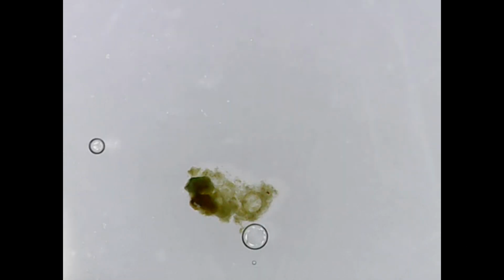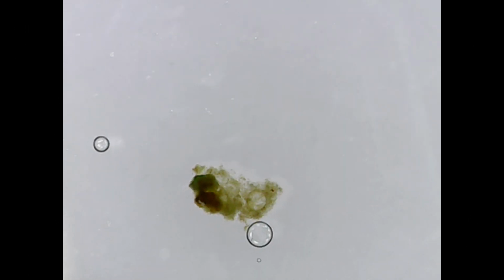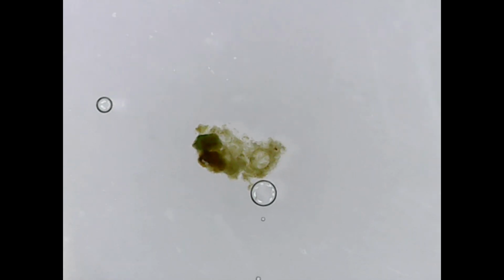So what you're seeing here is that water, and what you're seeing, that structure that's there within that water, is a piece of algae. I was actually surprised. I was expecting to find more microorganisms here. As I said, it probably is to do with the microscope, that I'm not looking at it through a fully scientific microscope, that I can go into much bigger or closer magnification essentially. But it's still quite cool to see that there is life, even within something that we just think is something that's holding water. This might freak out a few people, but I think it's quite cool. And this is another chunk of algae that we're seeing again within that water reservoir.